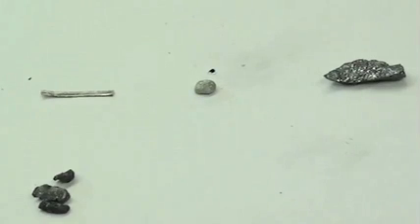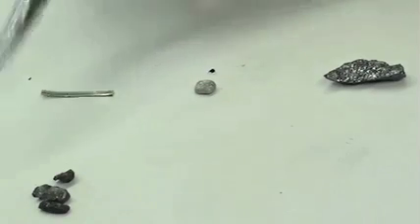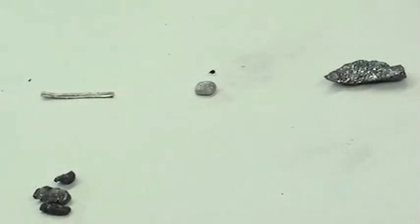The elements to be tested are magnesium, aluminum, and silicon, along with sodium which was shown in the previous video in period 3, and magnesium and calcium in group 2A.